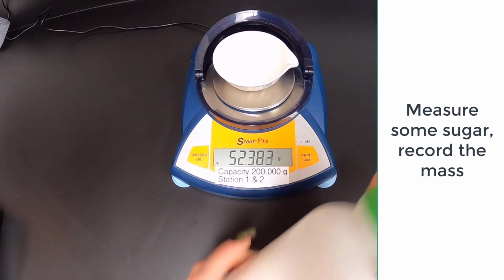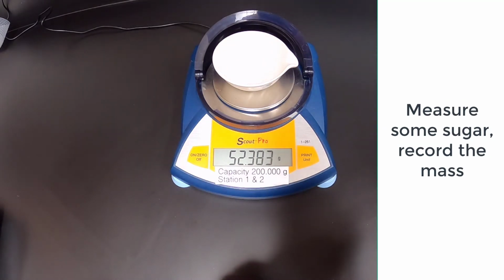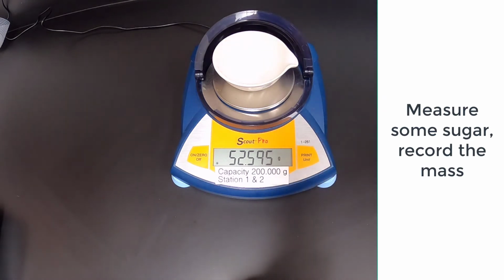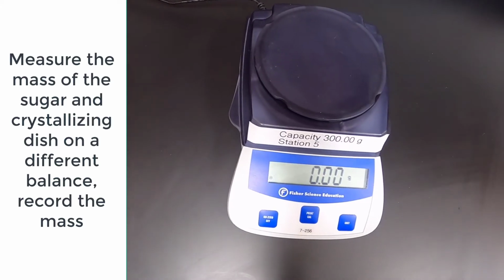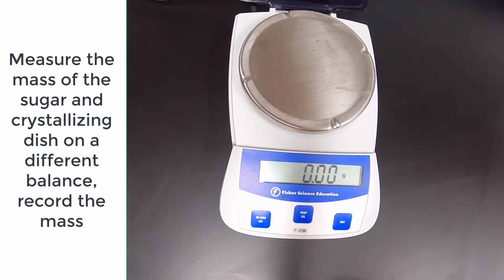Measure approximately 250 milligrams of sugar. Record the exact mass. Transfer the sugar to a different balance. Record the mass.